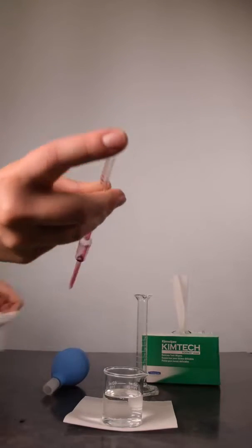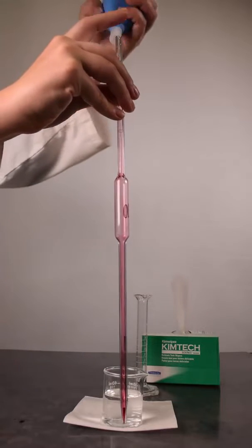Wipe the pipette tip before rinsing. Begin drawing air through the pipette outside of the beaker.